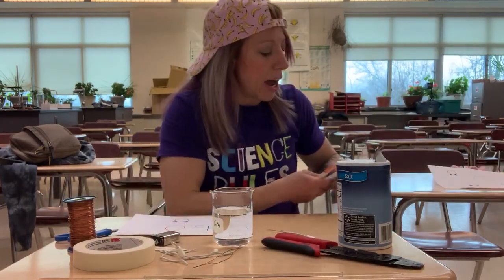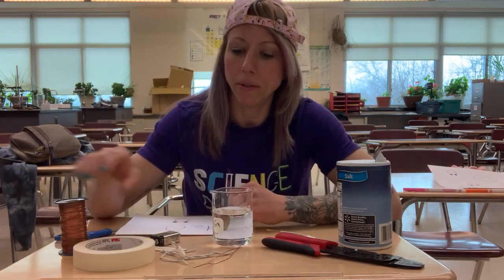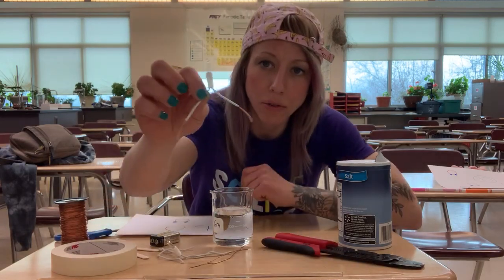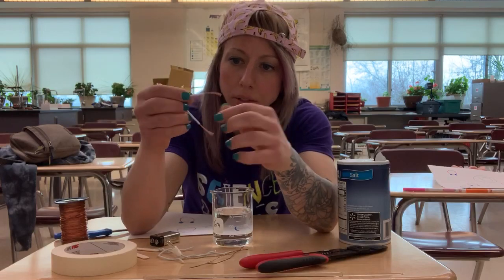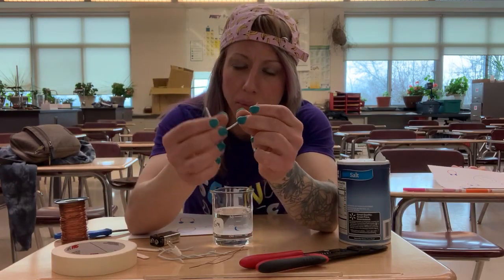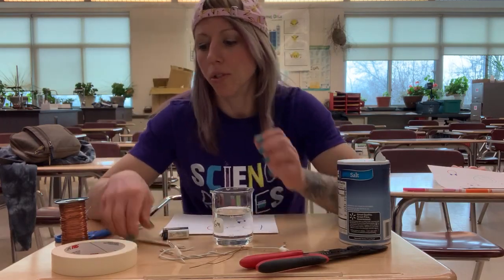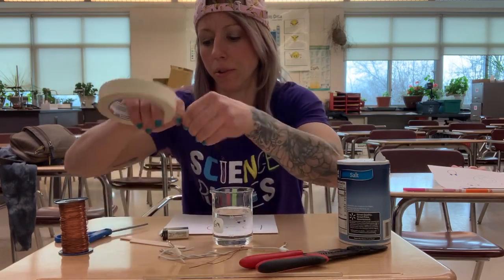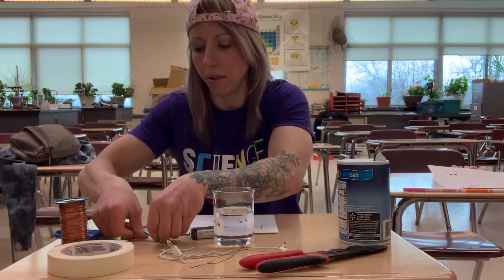So I'm going to show you how to create a meter where you could test this. So what you're going to need is some copper wire, tape, a few popsicle sticks, a retired Christmas light, which I have used a wire stripper thing to pull the covering off so that it exposes the bits of copper on the ends. And a 9-volt battery and some scissors. And so what I'm gonna do, and this would be really cool for you to build at home with your kids, I'm gonna start by just taping the two popsicle sticks together.